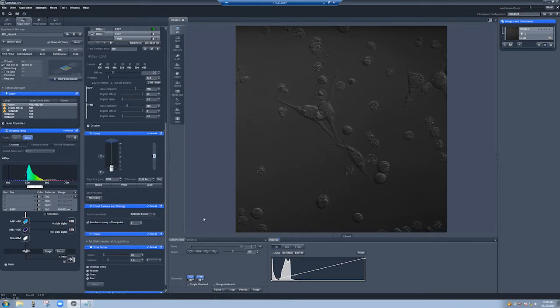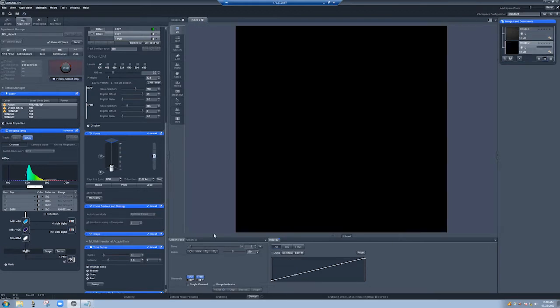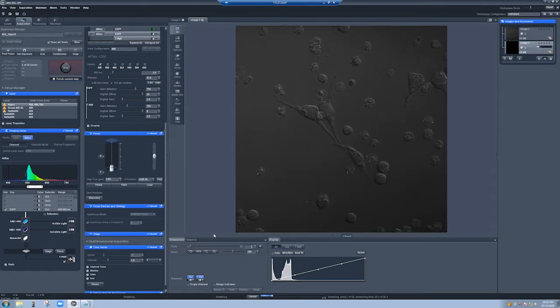So if you go to start experiment, you will see here that when it does the definite focus, there will be a message, definite focus, setting focus, and there it goes. And if you were in the room, you could see in the display of the definite focus some messages that indicate that it is finding the focus and then setting it. Okay, so this is really critical if you want to have something that's in focus, particularly in a long time lapse.